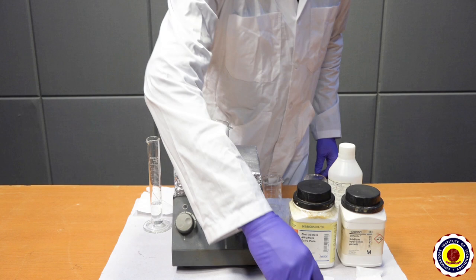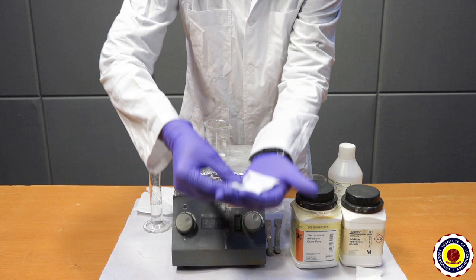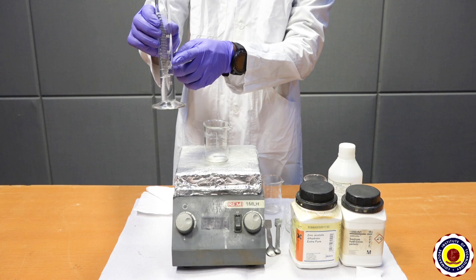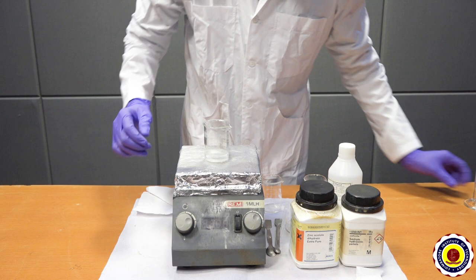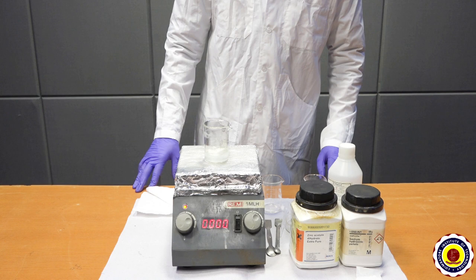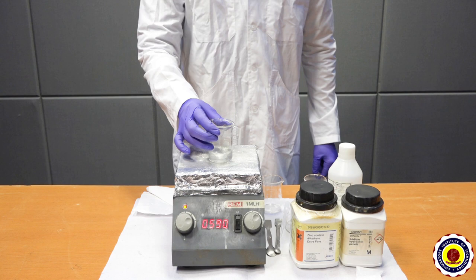Take a beaker, add 1 gram of zinc acetate dihydrate, and pour 15 ml of distilled water inside the beaker. Switch on the magnetic stirrer and stir the mixture constantly for 5 minutes to allow formation of the zinc acetate dihydrate solution. This is the zinc acetate dihydrate solution.